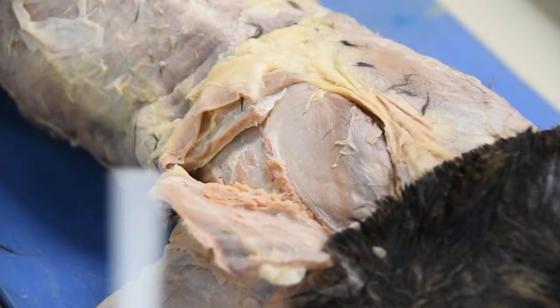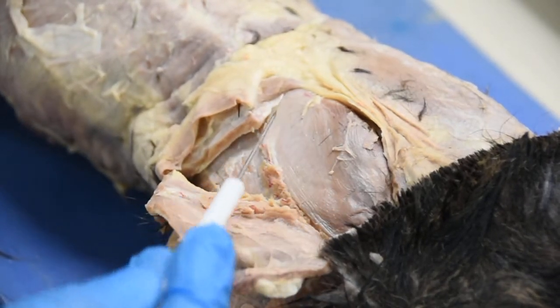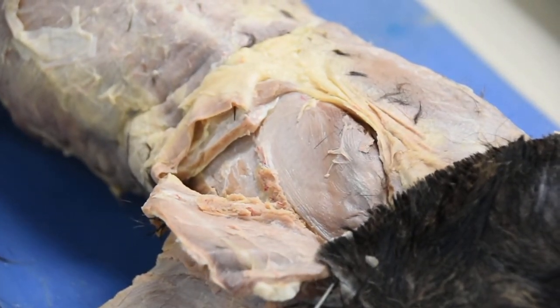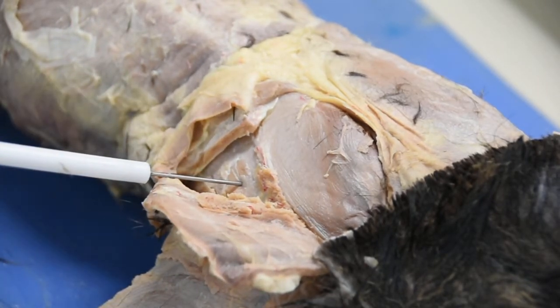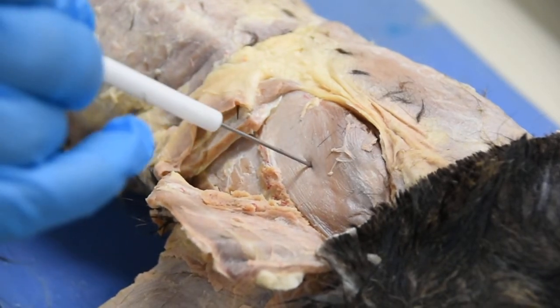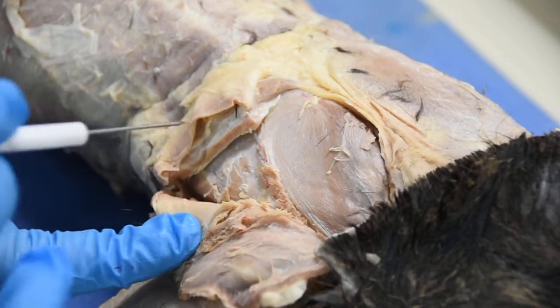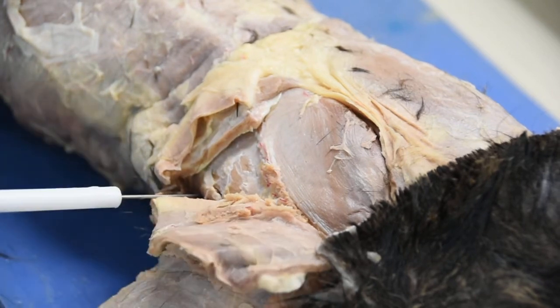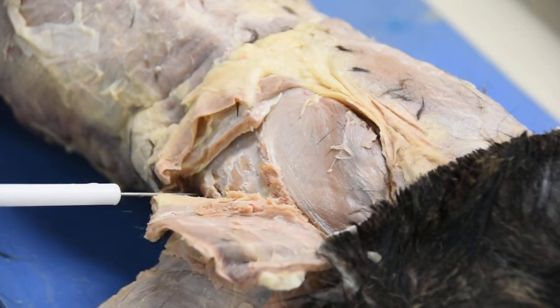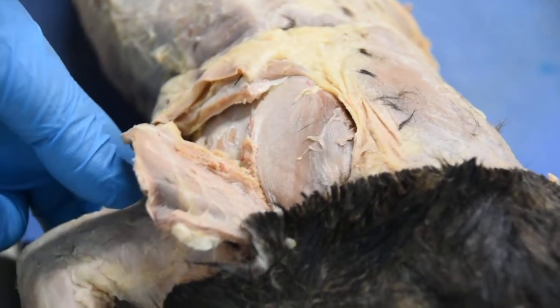So like humans, you have a muscle on top of the spine and one below it. If it's on top of it, it's called supraspinatus. And if it's below it, as I put the pin through it, it's your infraspinatus. So supraspinatus, infraspinatus. And again, if I go farther down, you'll see a separation for another muscle right here, and that's your teres major.